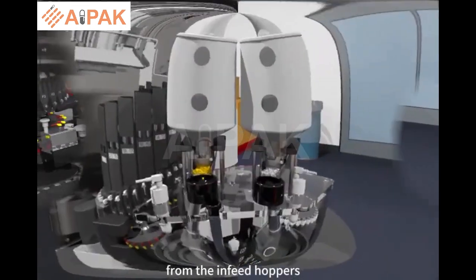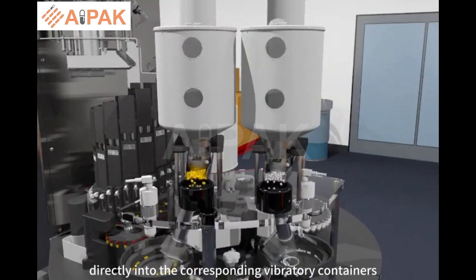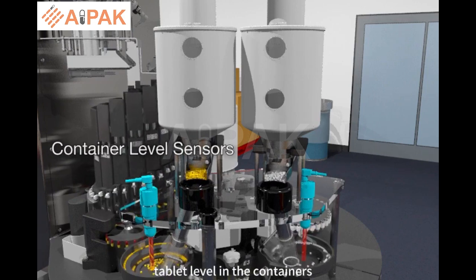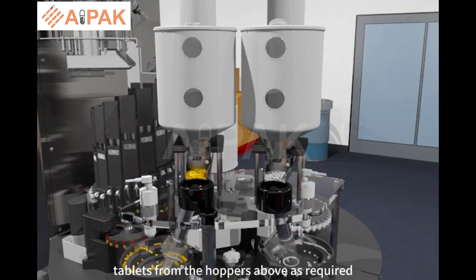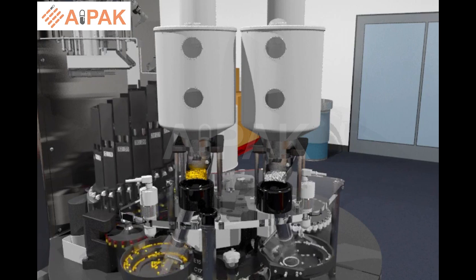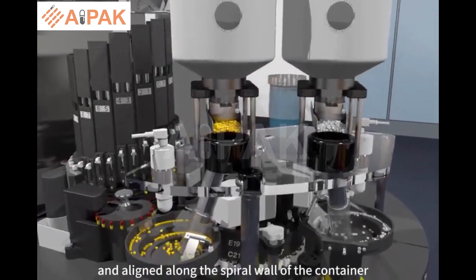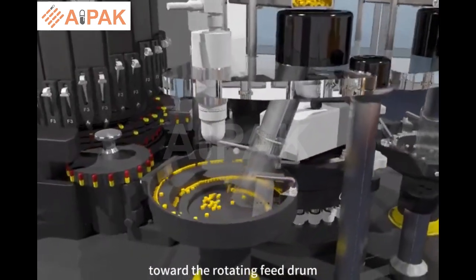From the in-feed hoppers, the tablets are gravity fed through chutes directly into the corresponding vibratory containers. Sensors detect the minimum tablet level in the containers and enable charging of the containers with tablets from the hoppers above as required. Through vibration, the tablets are arranged and aligned along the spiral wall of the container and transported upward in an orderly train toward the rotating feed drum.